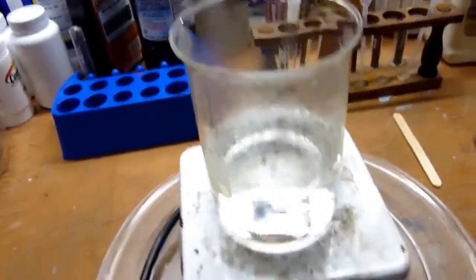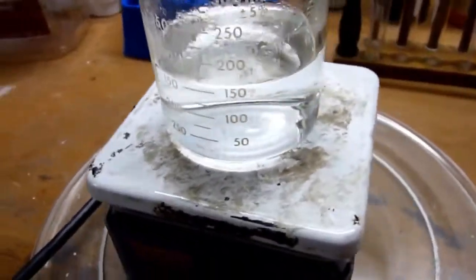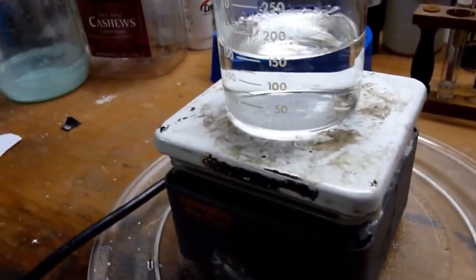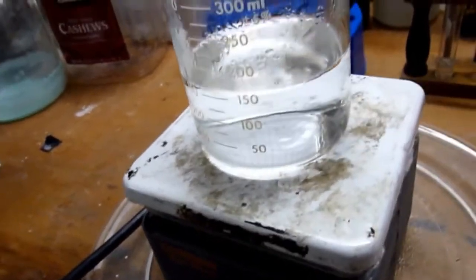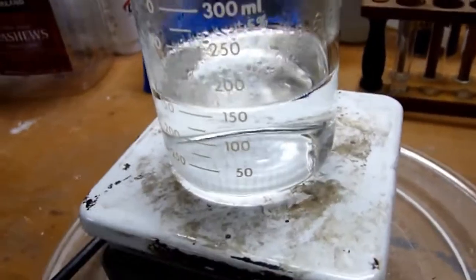So, you want to keep this as clean and dust-free as possible. Don't put a fan blowing on it and stuff to increase evaporation because you're just going to get dust in it. On the same note, don't try and stir it. Don't try and stick a thermometer in it or whatever because if you introduce any dirt, you're going to have a problem with decomposition.